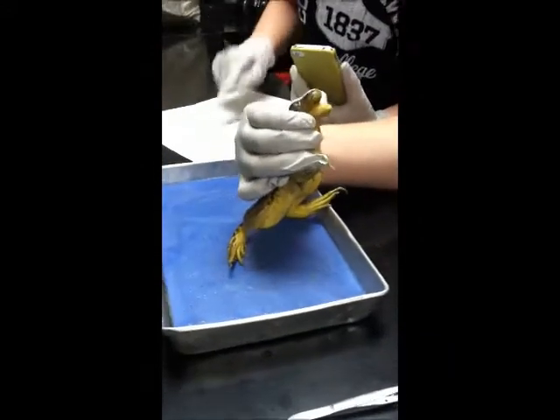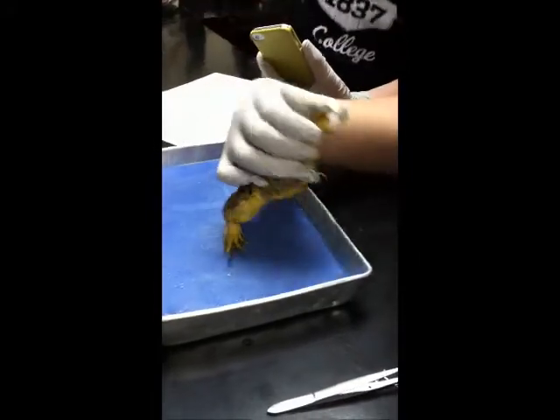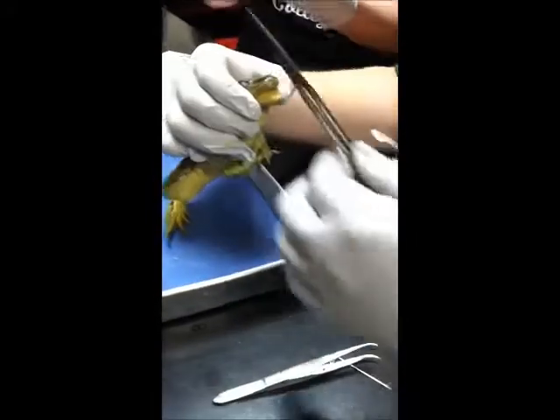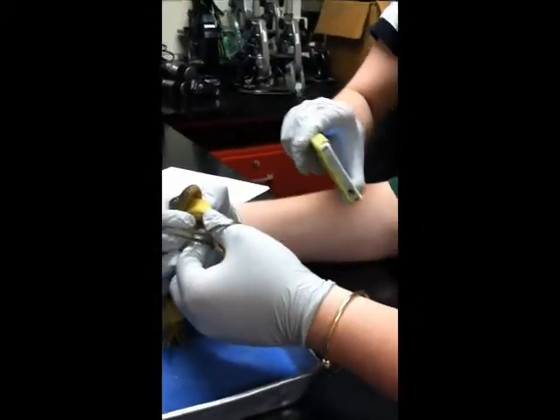The two holes near the mouth are the nostrils, called external nares — those little holes right there. It's not even open. Open the mouth! Oh my god, what is that? Is that even a tongue? Yes. That's a very unattractive tongue.